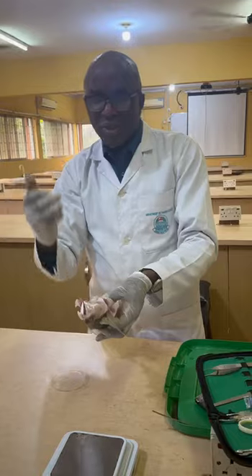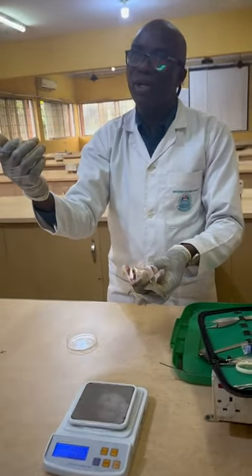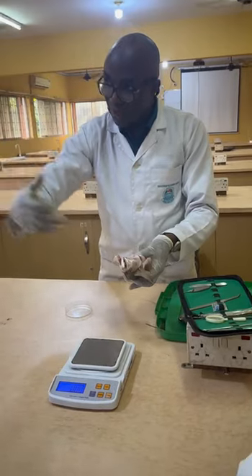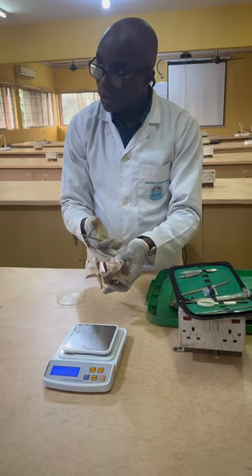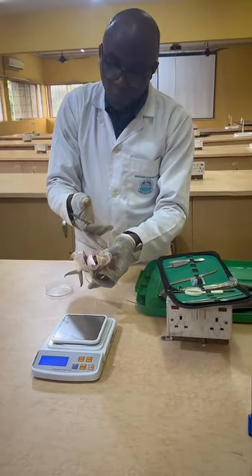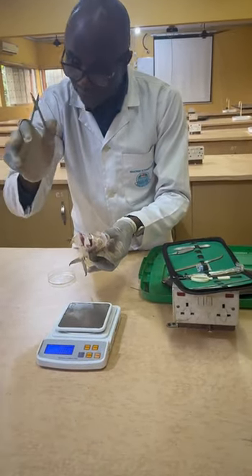What are the ducts? You have the excretory, you have the reproductory, and you also have the one from the digestive tract, the alimentary, the intestine. Let me put it that way. The intestine to release the urea or whatever. It's the ducts which all fuse at the anal region, from internal to the anal region, and they release through the cloaca.